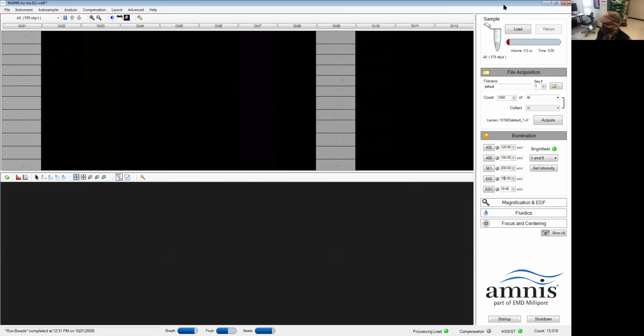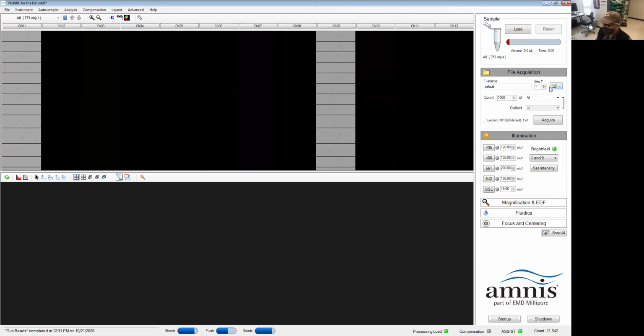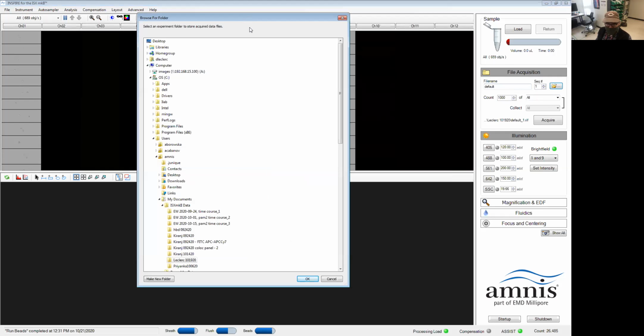We're going to do that using the right-hand side panel under file acquisition. You have the file name. This is going to be the name of your data file. This is just an increment tool. And then this folder icon here, if I click on it, this window pops up, and this is where we decide where to save the data.